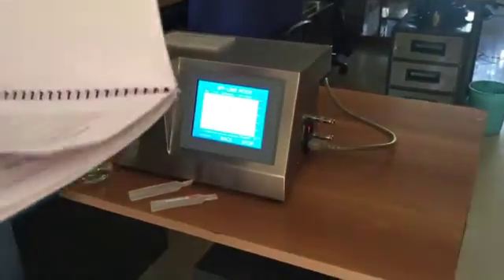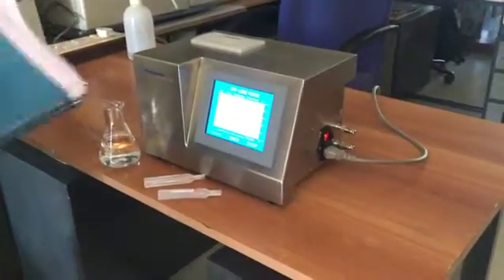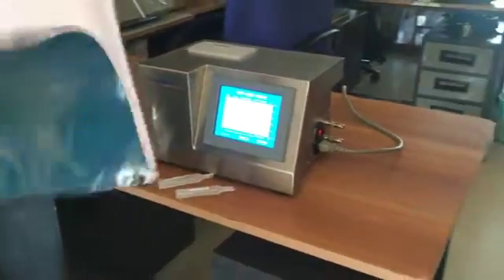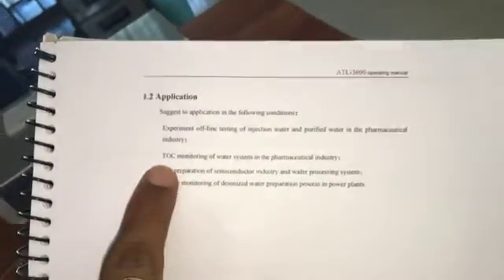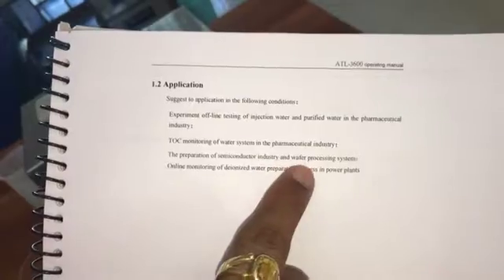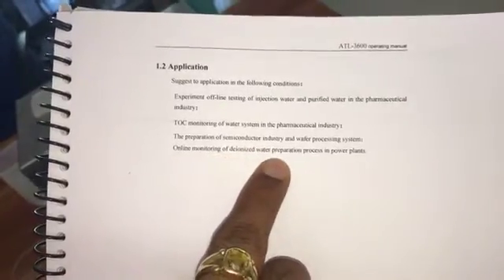Apart from pharma, biotech, and water for injection, the same machine can be used for other applications as well. As shown in the manual, applications include TOC monitoring of water systems in the pharmaceutical industry, semiconductor wafer processing systems, and online monitoring of deionized water. Even drinking water can be monitored — you can check both the TOC level and the conductivity level.